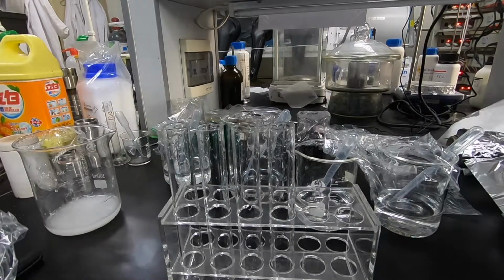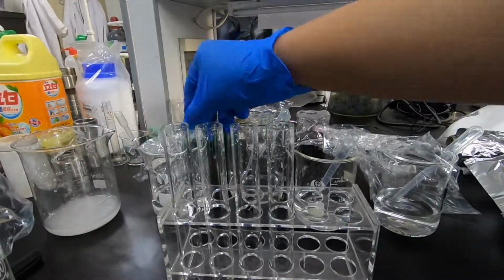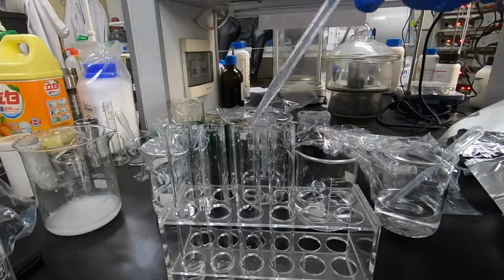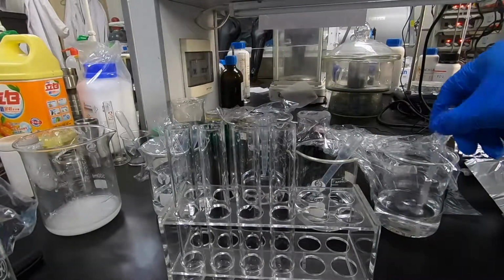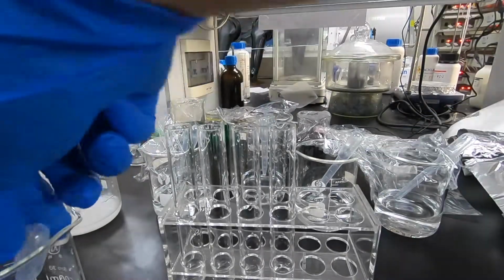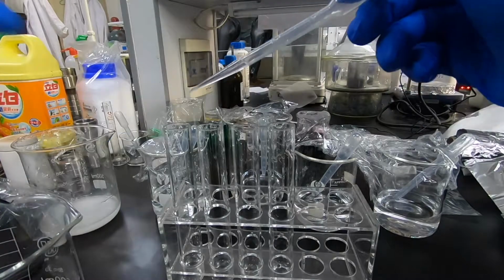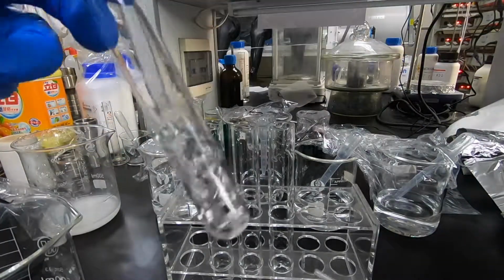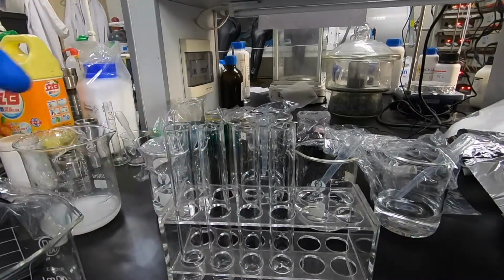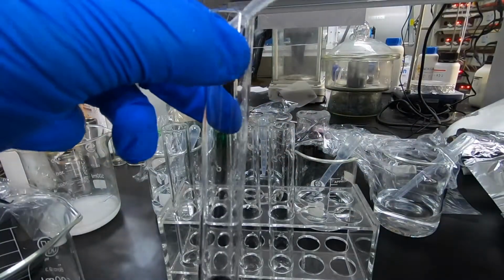So we have switched the solutions. Now in test tubes number 1 to number 4 are solutions 1, 3, 4, and 5. And the solution used to react, which I was holding, was solution number 2. So solution number 2 has no reaction with solution number 1, and we see that clearly. And solution number 2 produces bubbles with solution number 3, or fizzing if you prefer it that way.